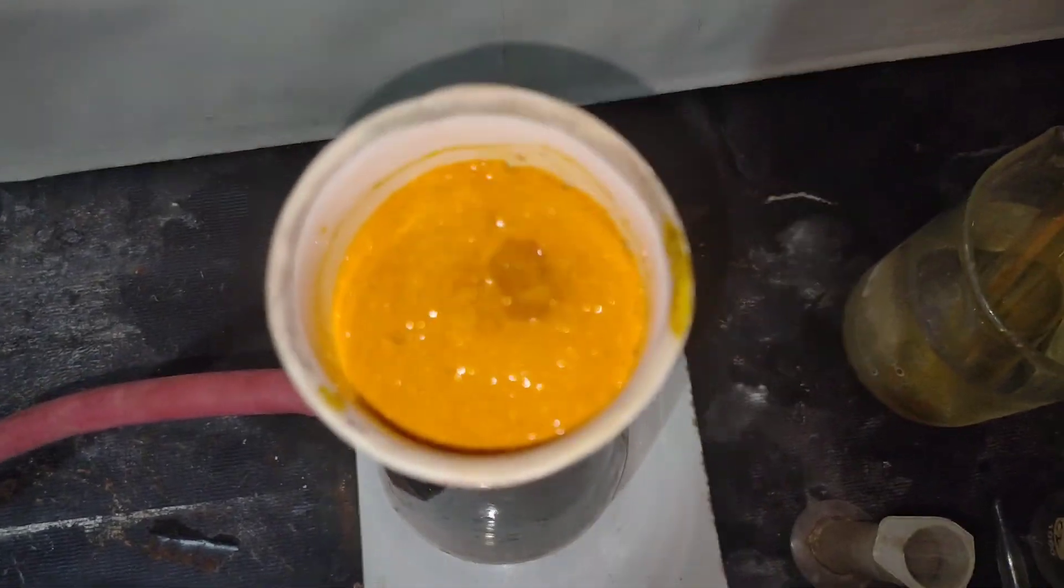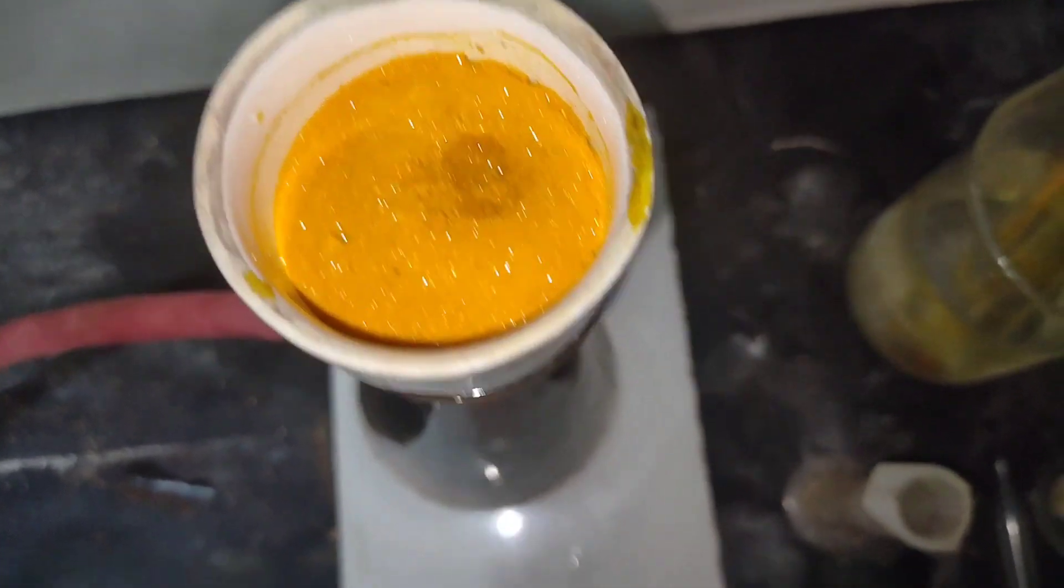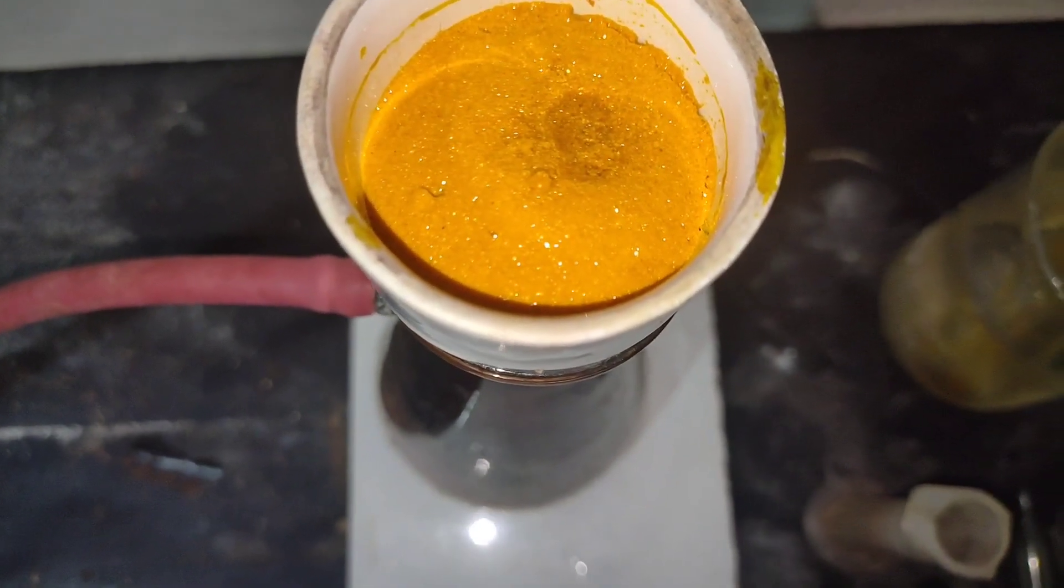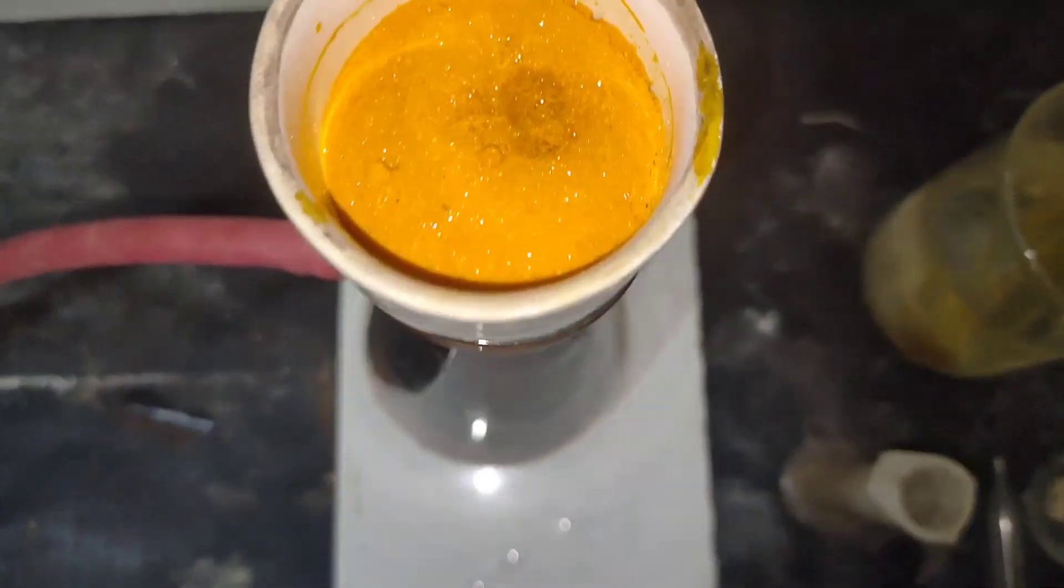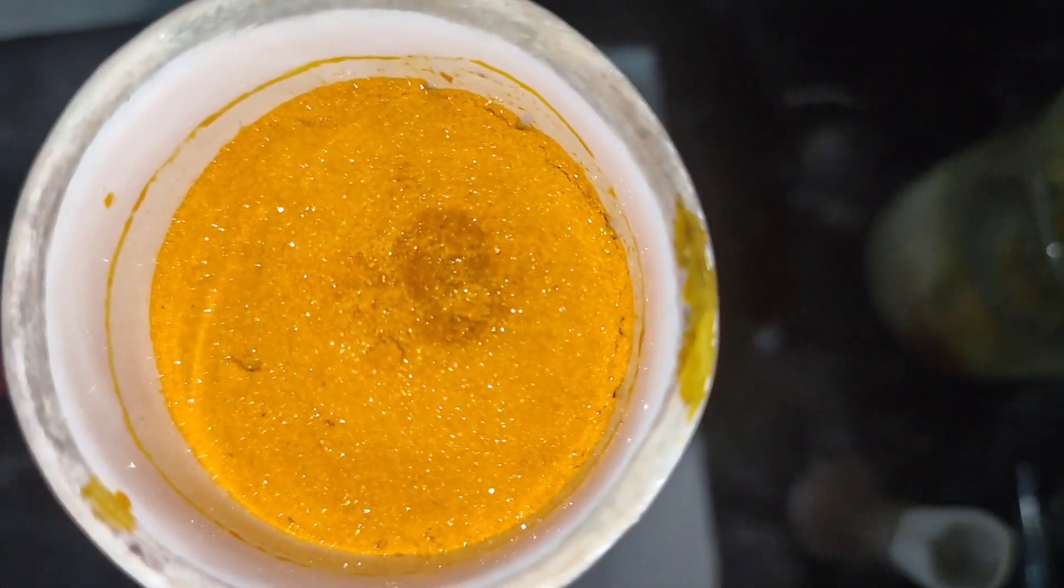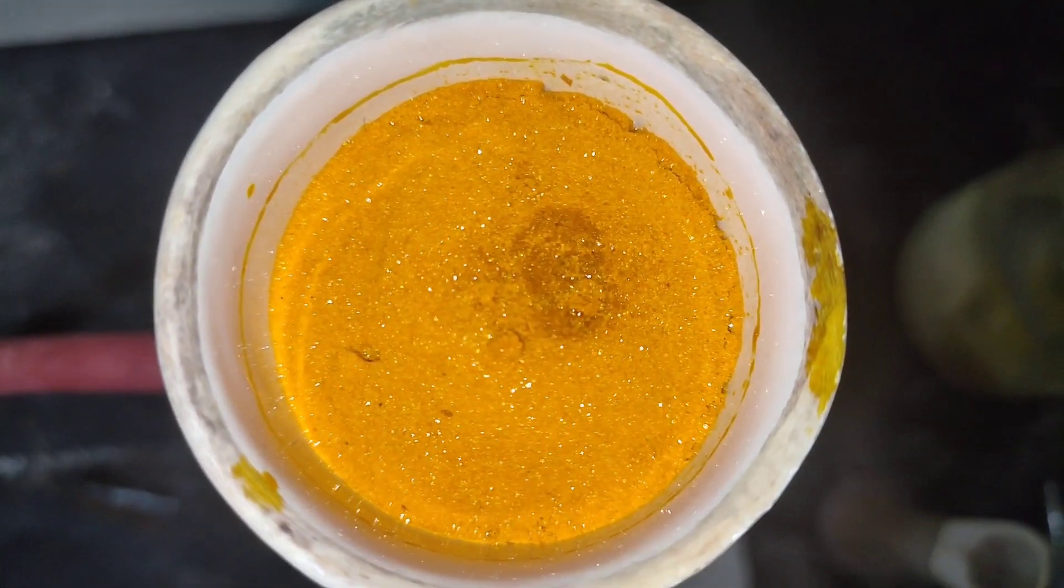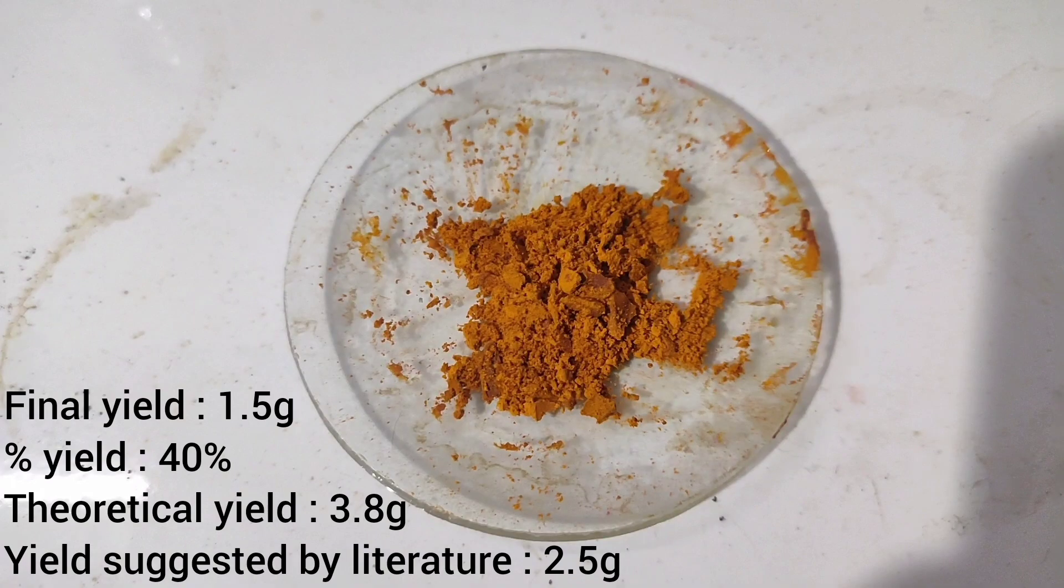I left these crystals on the funnel to dry in air, but when I checked after 2 hours, I saw that the crystals had started absorbing moisture and turning into a solution. I immediately took off all the solid from the funnel and dried it in the vacuum desiccator, which I should have done earlier.